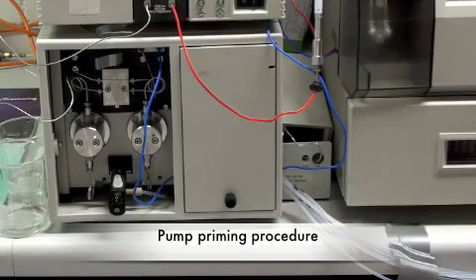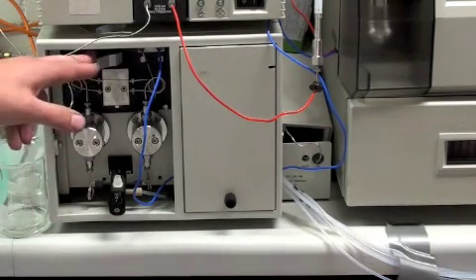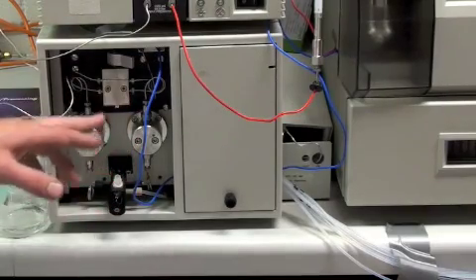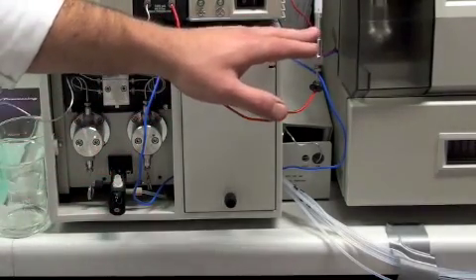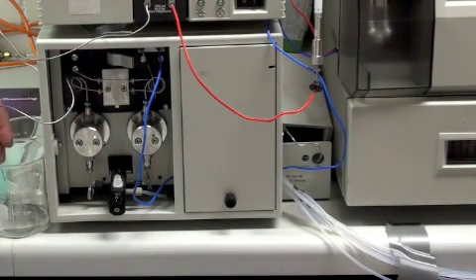Whilst the auto sampler is purging, the next step is to prepare the pump. The process starts by turning this valve here to the right. This stops the mobile phase from being pumped through the column, which is here. And the solution actually goes out through to a waste container here.